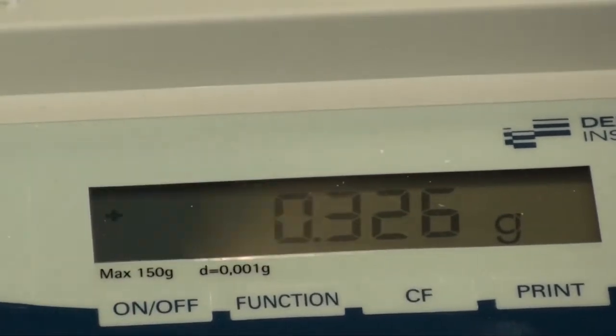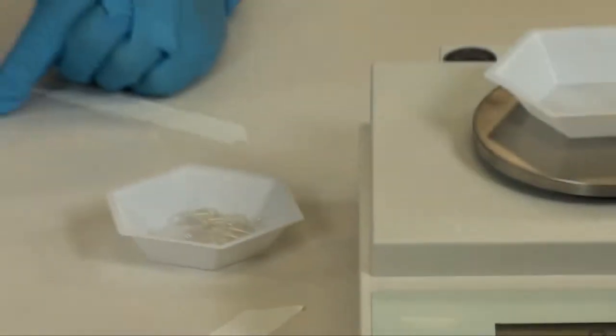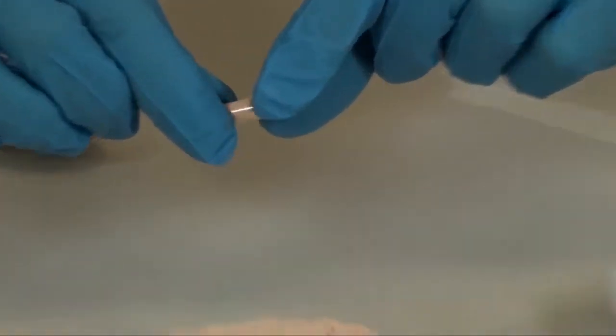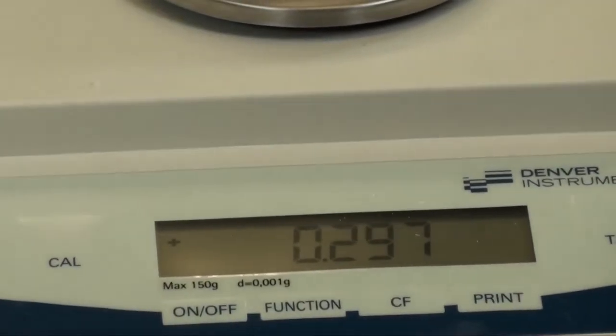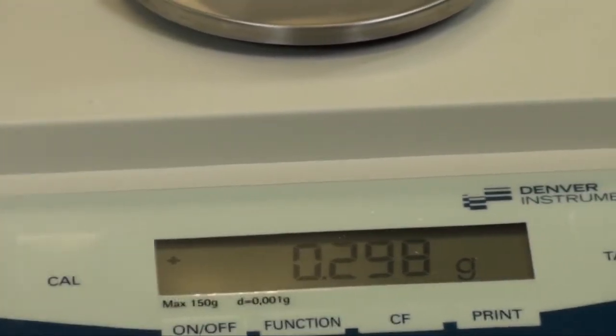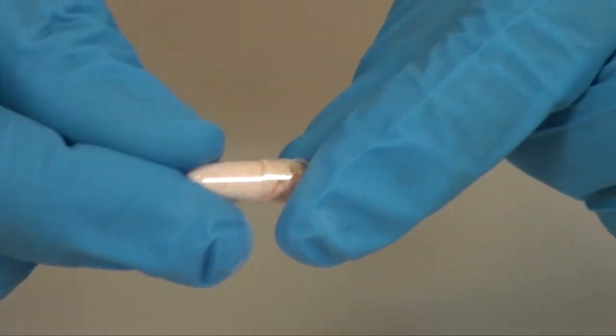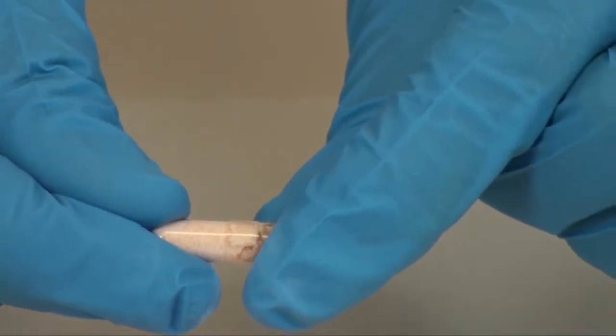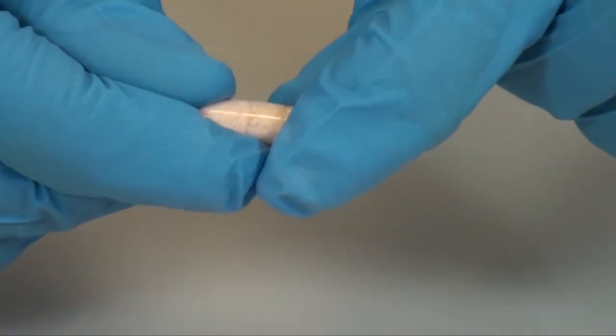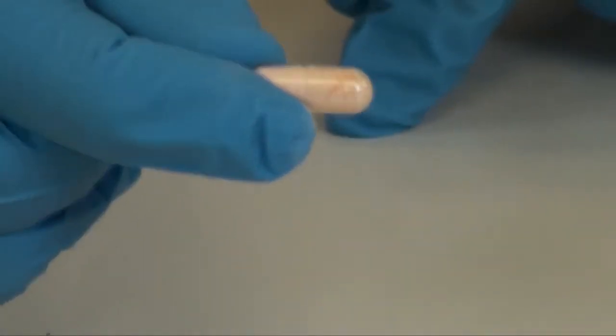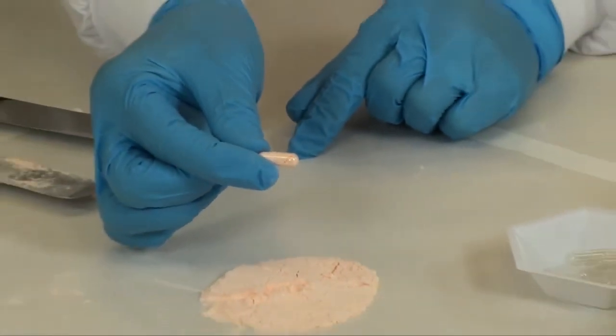When I see the weight, I notice that it is too heavy, so I need to remove some powder. I am going to remove a little powder, place the cap back on gently, and check the weight again. It is now within my 5% error. Take the capsule and press it firmly together until you feel a click. This will lock the cap onto the body. This capsule is now ready to be dispensed after it is polished.